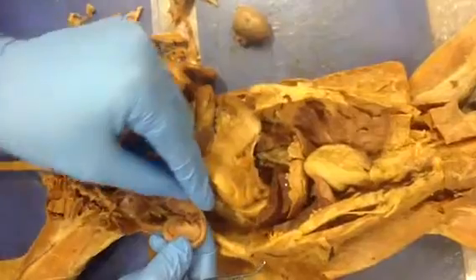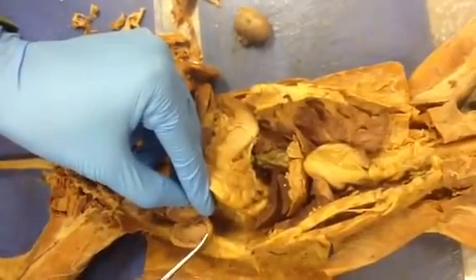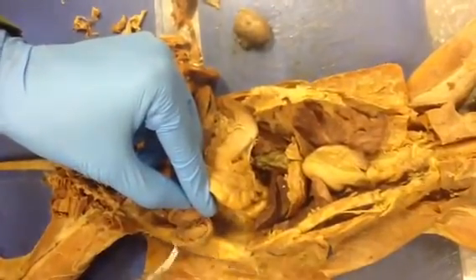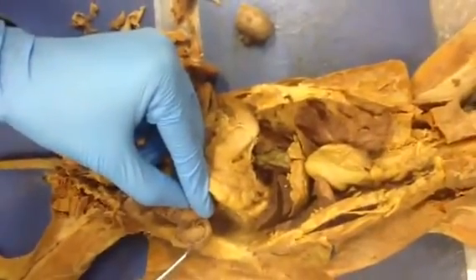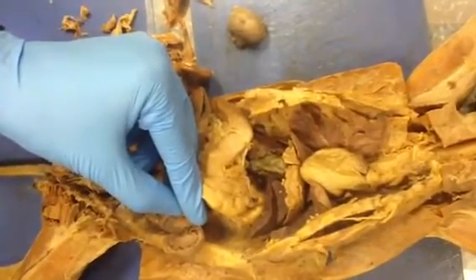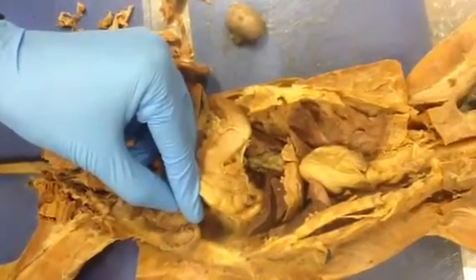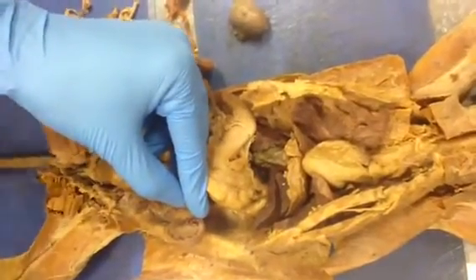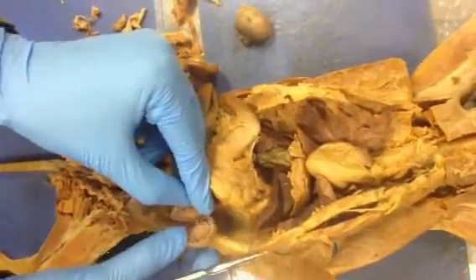Which is the medulla specifically? The white? This is the medulla. Which one is the cortex? This outer ring. That is the cortex. The dark line is dividing the medulla from the cortex. These are the medullary pyramids. Because of the blood circulation, you can't see them properly. If this was a dog or big animal, you would see them in more detail. So the dark lines are the tips of the medullary pyramids.